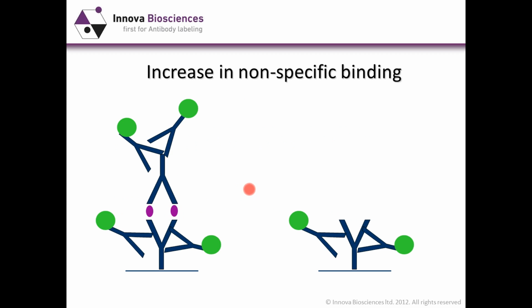We'll go back to this sandwich assay where you have your capture antibody here and your detection antibody here. Your secondary antibody, if you have your capture and detection from the same species or even a similar species, may well bind to both your detection antibody and your capture antibody. That will give you a signal even in your negative controls, and that's best seen here on the right-hand side. Here's your capture antibody. There is no antigen bound, but your secondary antibody may still recognize that capture antibody and give you a false positive signal in your assay.